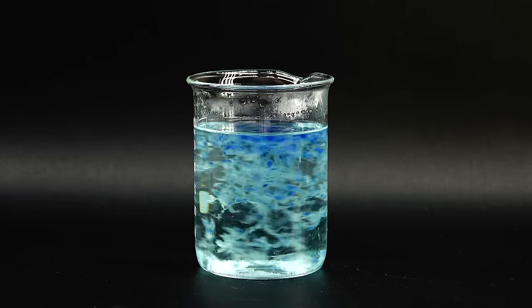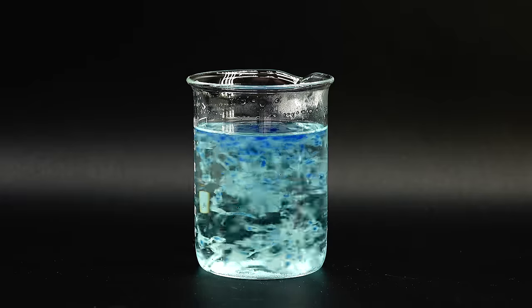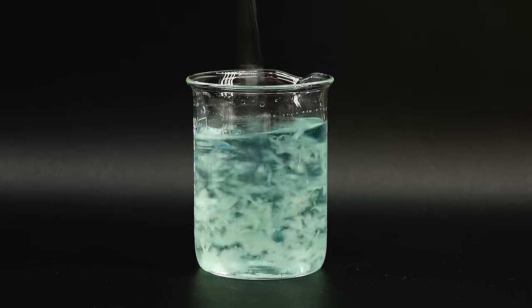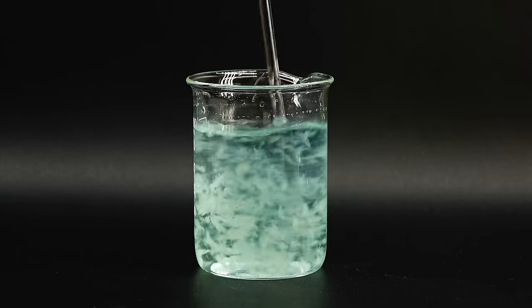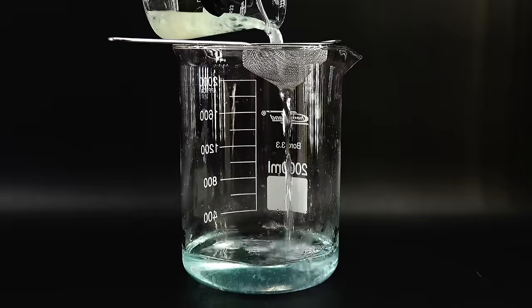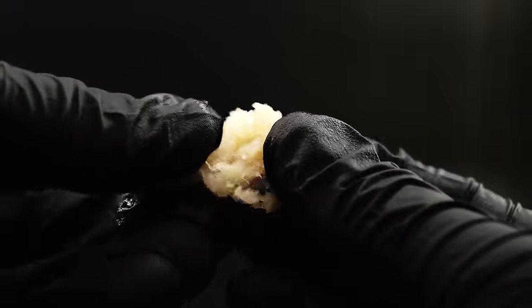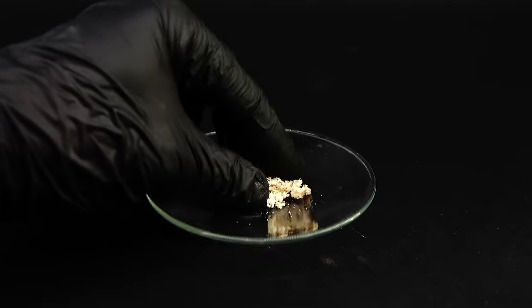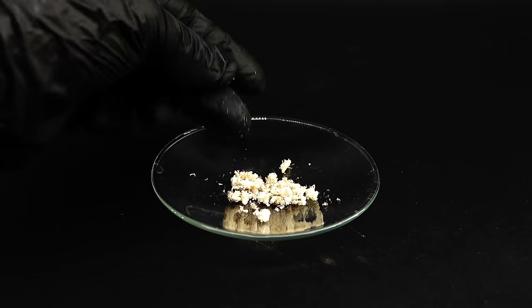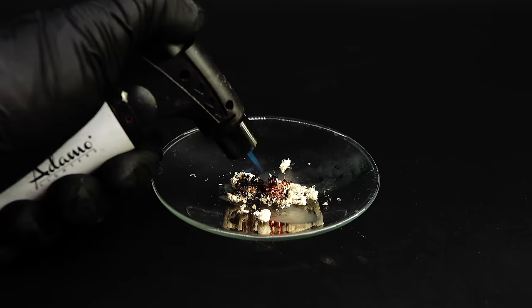I thought that if I will be more gentle next time and make the fiber thinner, it would be stronger, and for now I wanted to explore the properties of this funky wood. The acid took quite a bit of time to destroy all the blue complex, in the end resulting in these white and delicate flakes that sank to the bottom of the solution. I got them out using a sieve, and as expected they were incredibly soft, resembling some jelly more than a fiber. I dried this wood jello in an oven, and when dry, its texture was quite similar to that of the starting cellulose, but the fibers were way shorter and a good bit denser. This material also didn't want to burn at all, which was quite interesting.